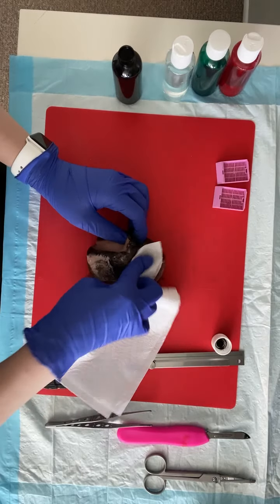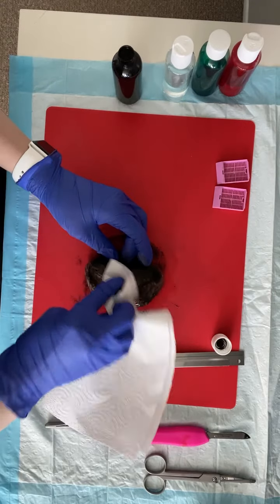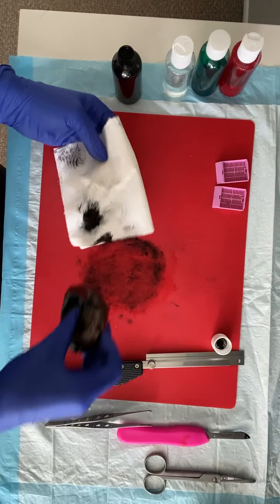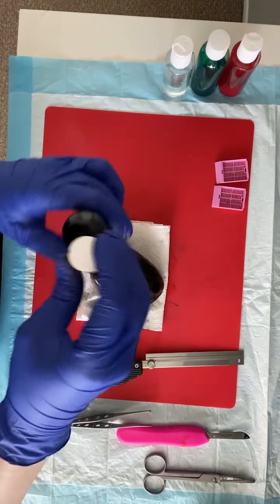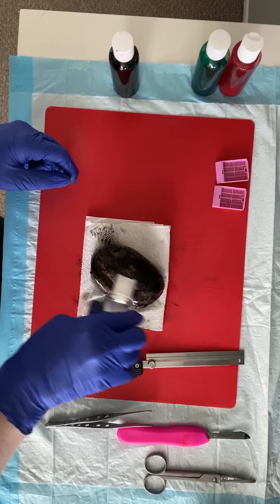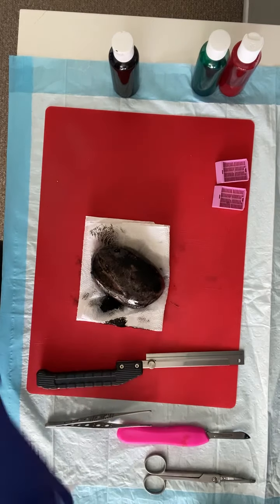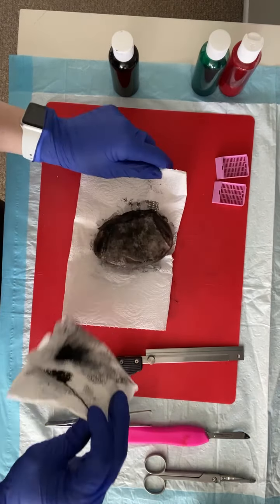Just like with all margins, some places will have you ink your margin before you shave it, just for embedding purposes. We've inked our entire outer surface black, now we're going to mordant it. The ink sticks really well to your tunica vaginalis but not so great to our tunica albuginea, but we're going to make do with what we've got.